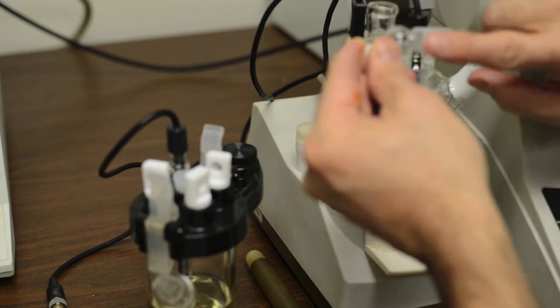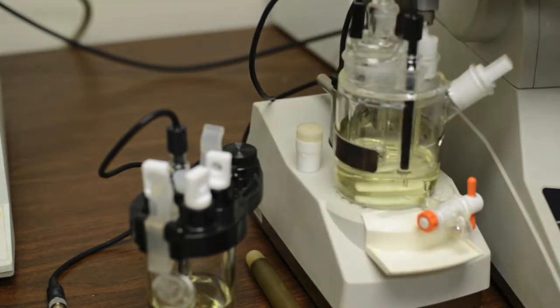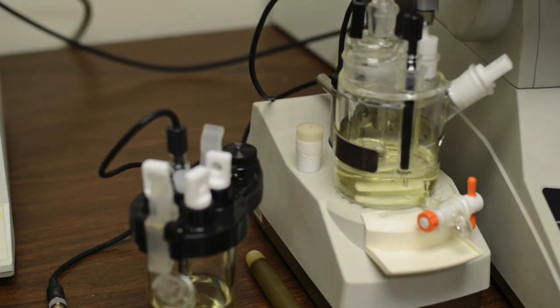And when we do this and we put it in to the port, it creates a nice secure fitting. And it's not airtight, we don't have airtight vessels, but it creates a very tight fit.